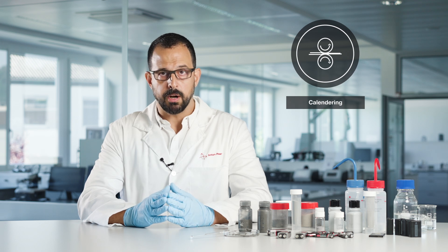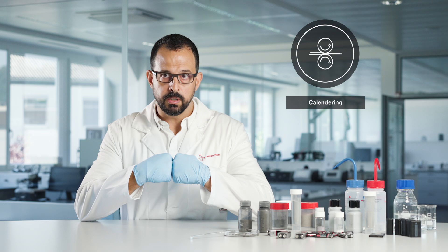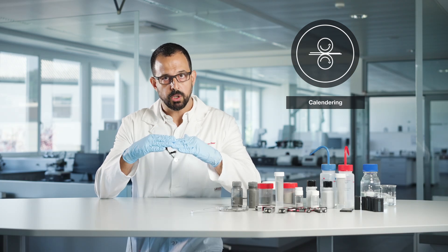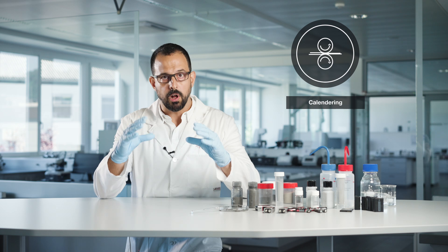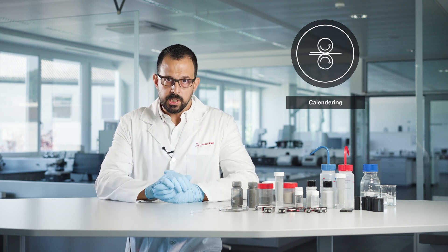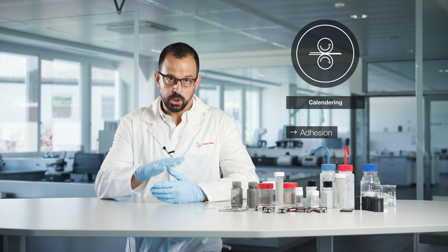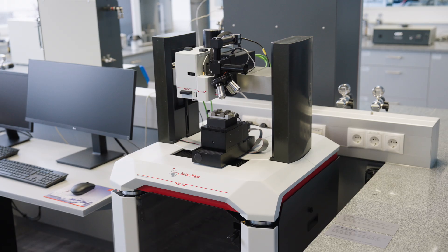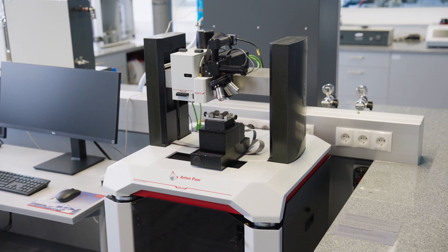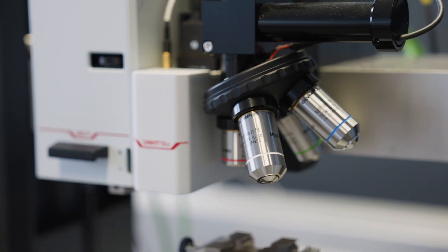Here, the electrodes are passed through two rollers running against each other for the purpose of reducing the porosity of the electrode and to reduce the overall volume of the battery. After these three steps, one way to test the adhesion of the slurry onto the current collector would be to perform scratch and indentation testing with an instrumental scratch and indentation platform.